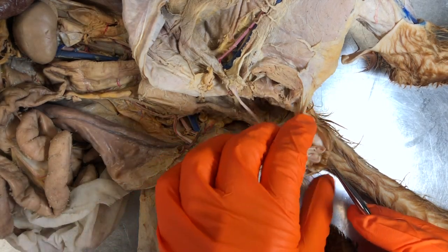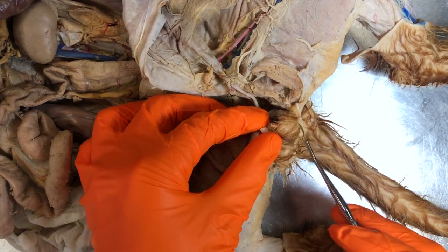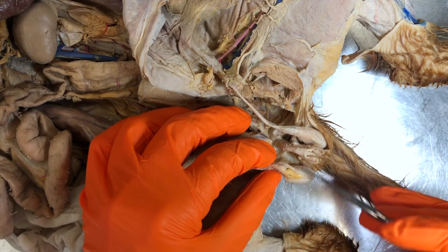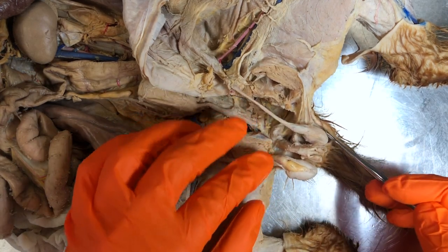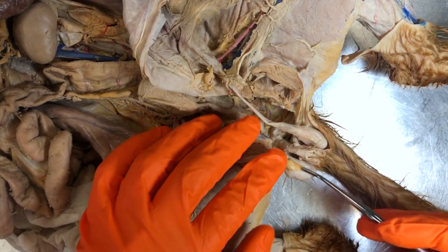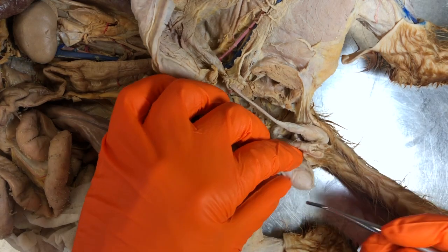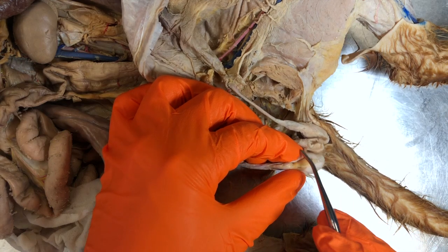Let's start externally. The sac-like structure you see here is the scrotum. When we cut that open we can see these two structures — we have two testes. This is the left testis and this is the right testis. Remember: testis is singular, testes is plural. The testes are covered by a couple of layers.